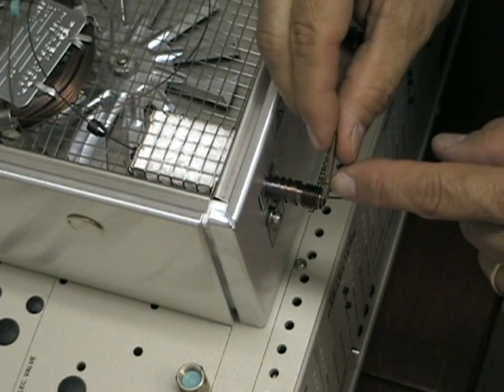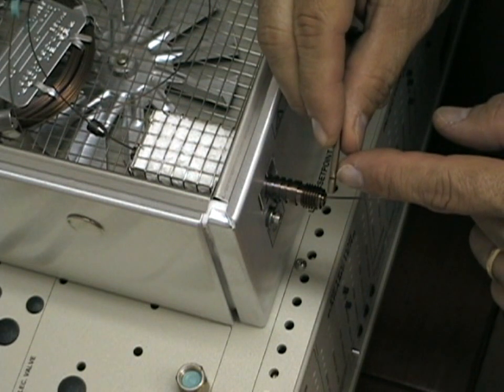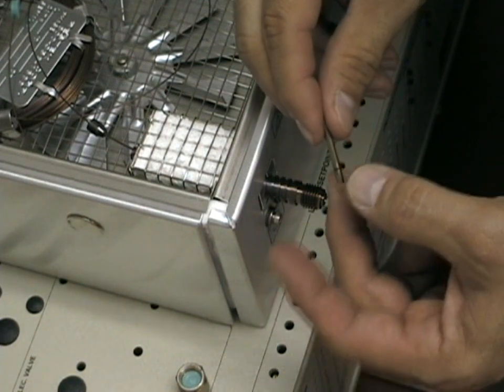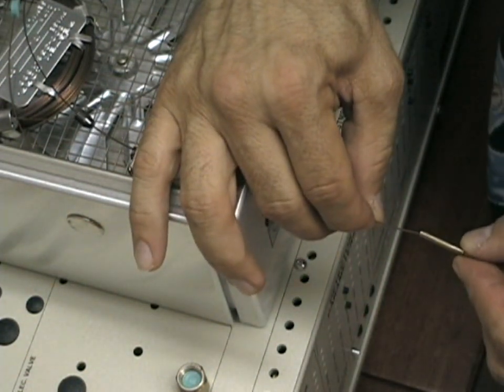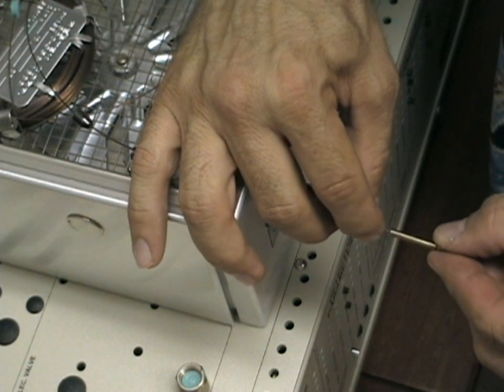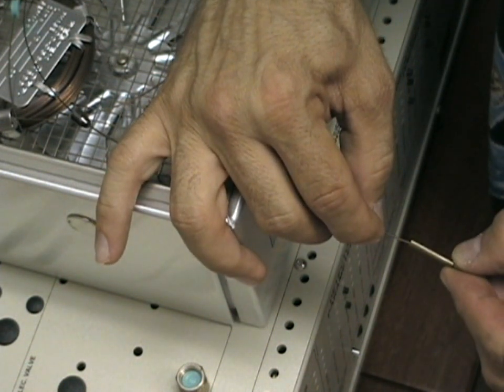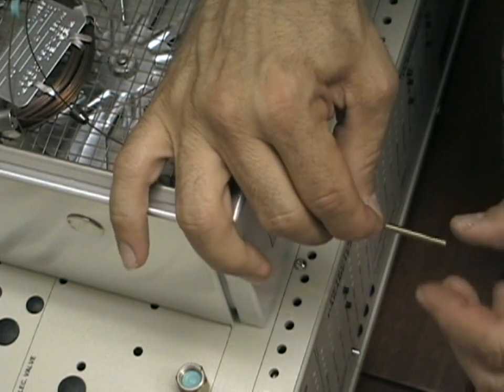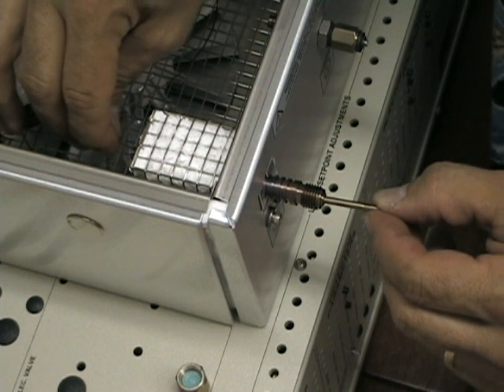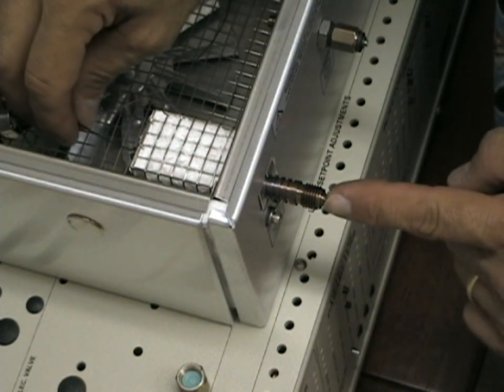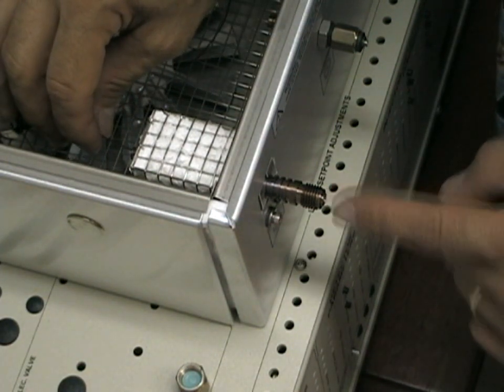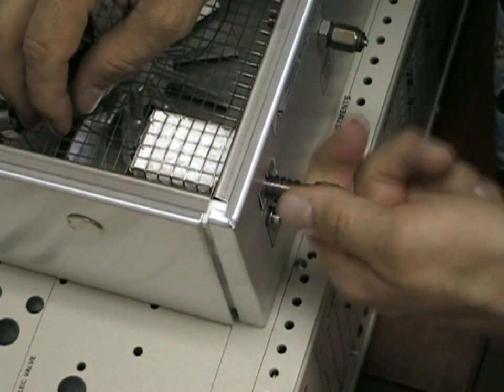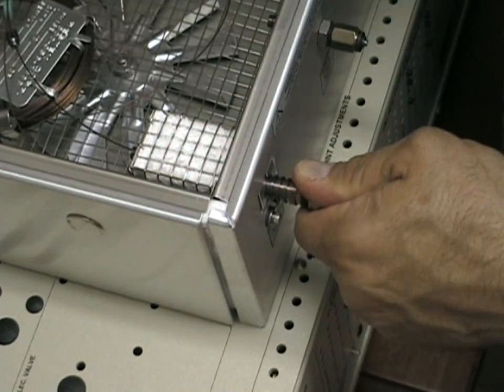Now you have the capillary needle guide which has a small slot cut toward the front end of the needle guide. Insert the column approximately halfway through using your finger to roughly position it, and then carefully push the needle guide into the heated injection liner. Put the septum nut back on the front of the GC finger tight.